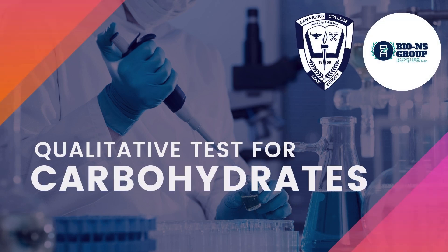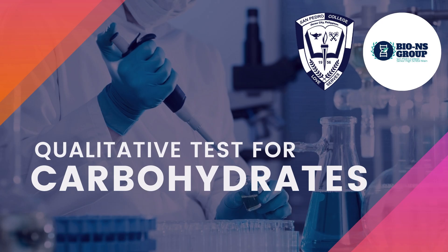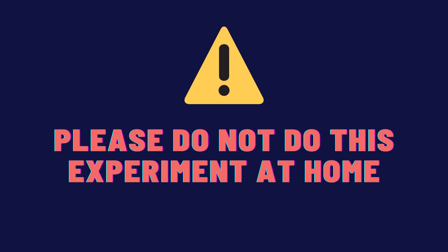Hello SPCians! Today's experiment is all about the qualitative test for carbohydrates. In this experiment, a qualitative test for carbohydrates will be done to determine whether the carbohydrate is a simple sugar, an oligosaccharide, or a polysaccharide. The experiment discussed in this video is provided as a resource for SPC senior high school students.